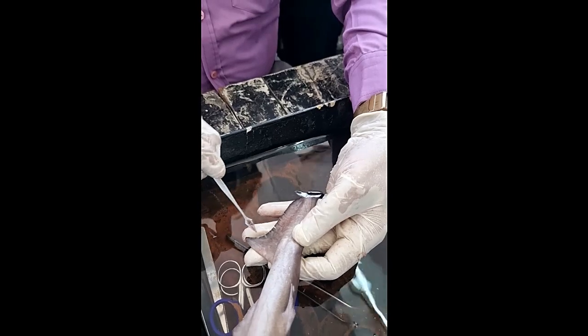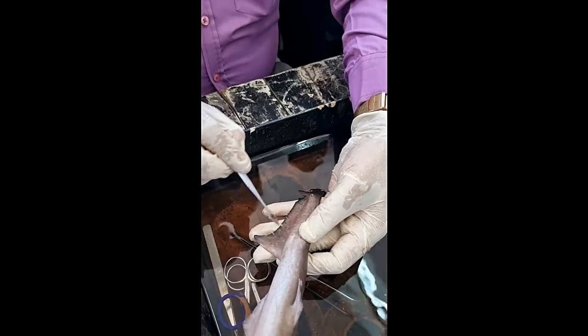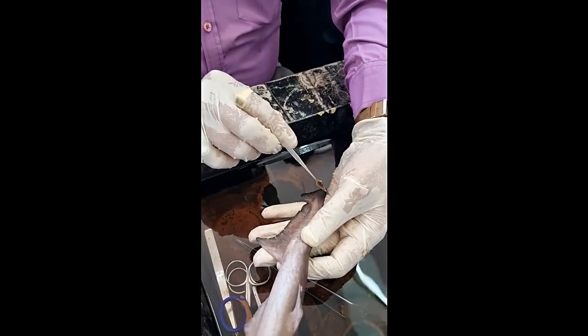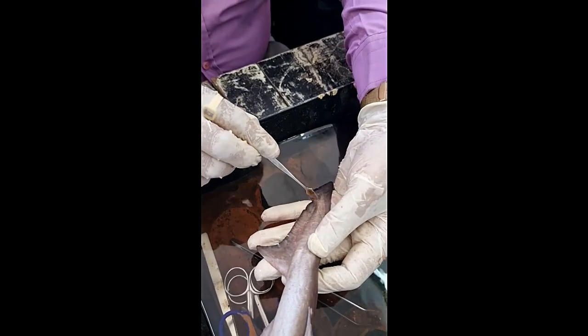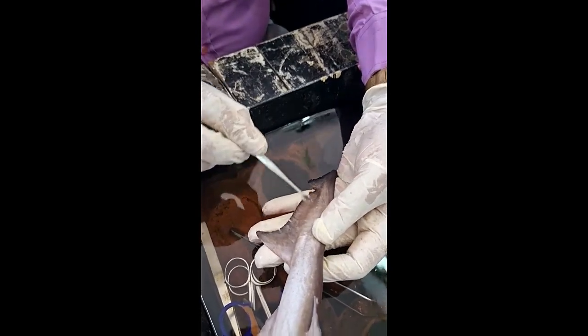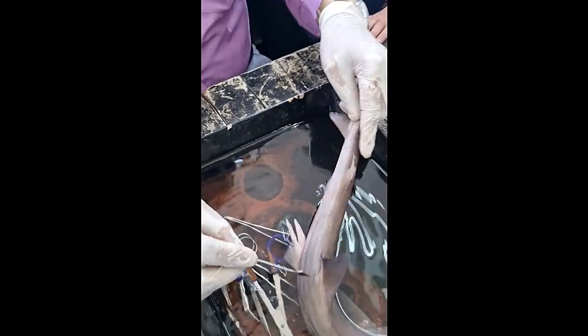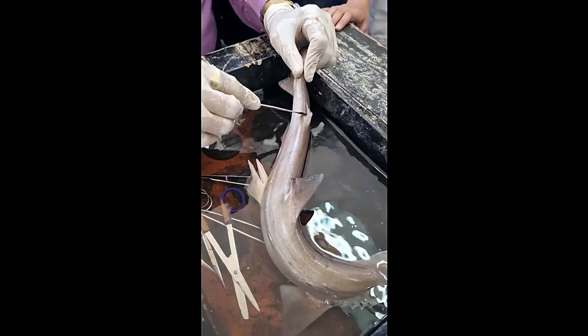The tail fin is divided into two parts — this is called the ventral lobe and this is the dorsal lobe. These are unequal and asymmetric, so this is known as the heterocercal type of tail.